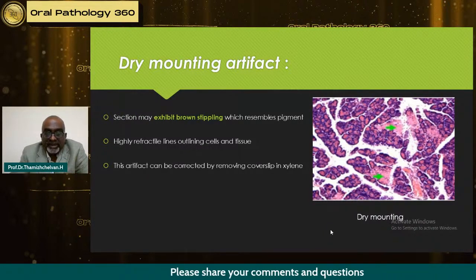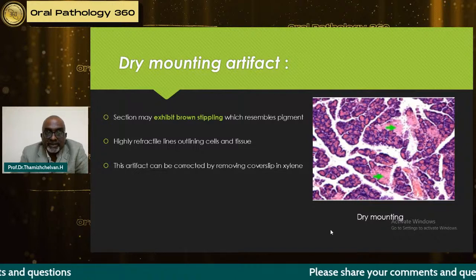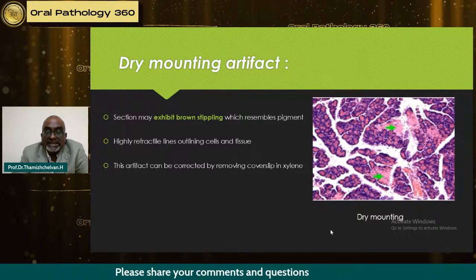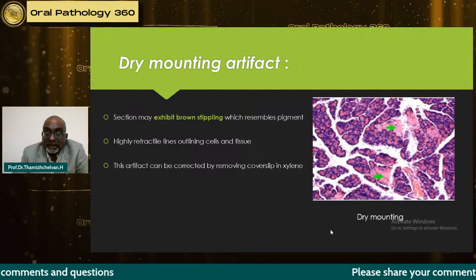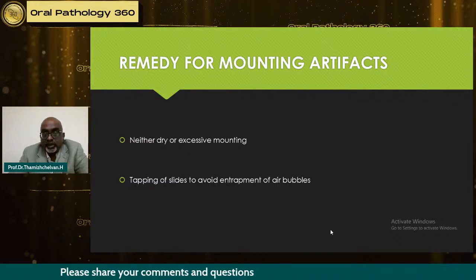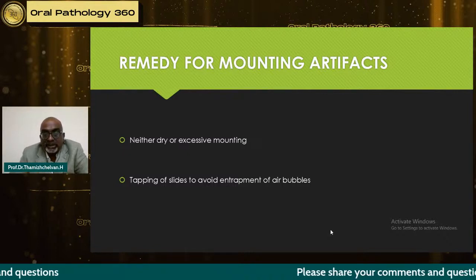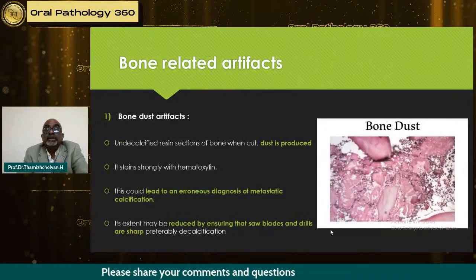And dry mounting artifact is when we try to dry completely because we don't want to see any wetness here. So what will happen is it will exhibit something with a lot of pigments inside, and this can be corrected by removing the cover slip with xylene and remounting. So neither dry nor excessive mounting, and tapping of the slide, is very important to avoid entrapment of air bubbles. You can go back to your prosthetics, where we always tap the impression tray to avoid entrapment of air bubbles in impressions here.